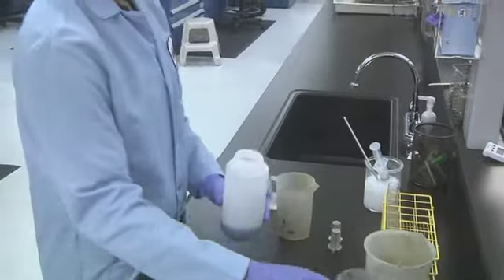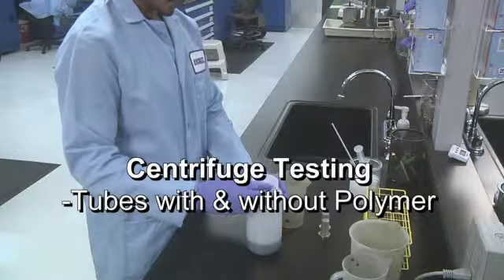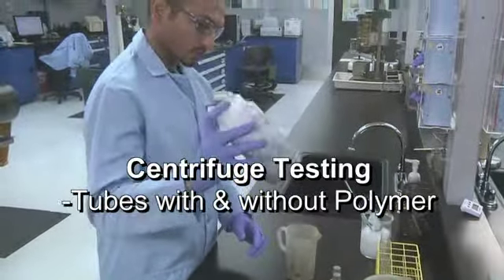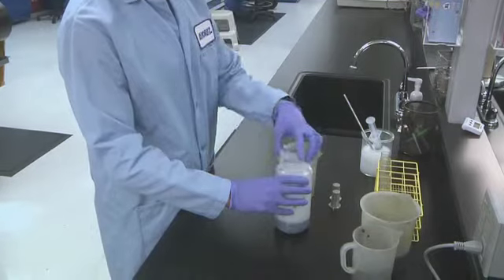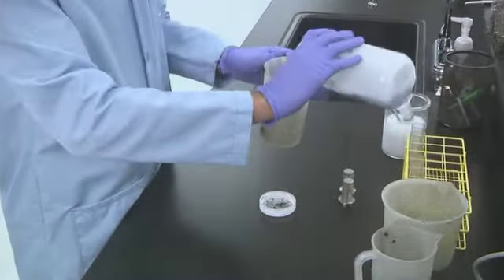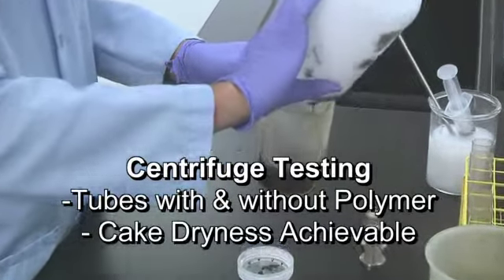Centrifuge spin-down testing consists of 2 parts. The first part is centrifuge tubes with and without polymer. The spin tube test determines if and how well the sample will settle under centrifugation. The second part is to determine the cake dryness achievable.